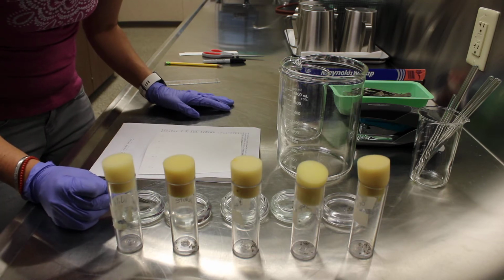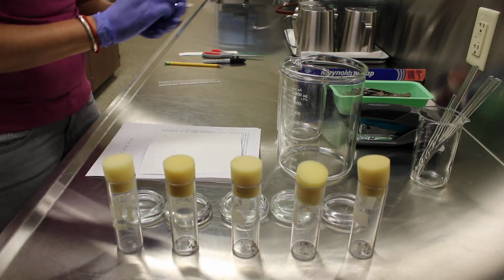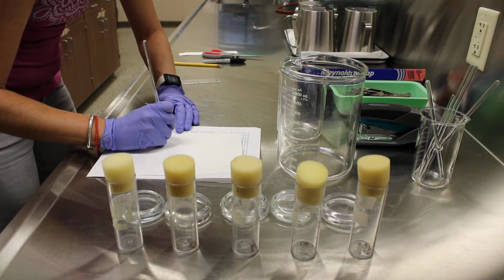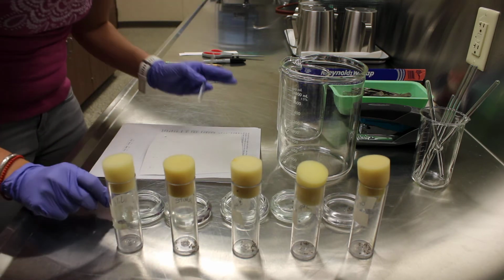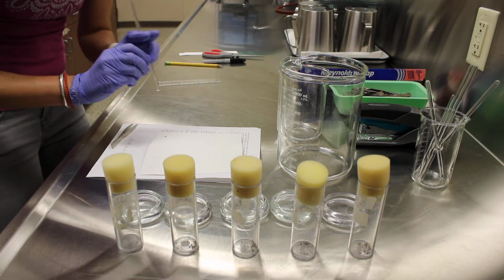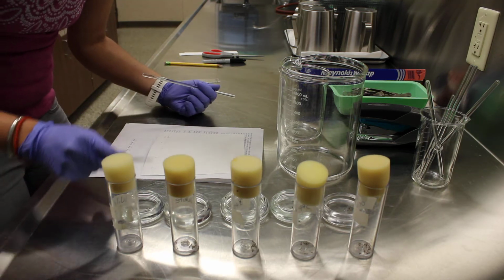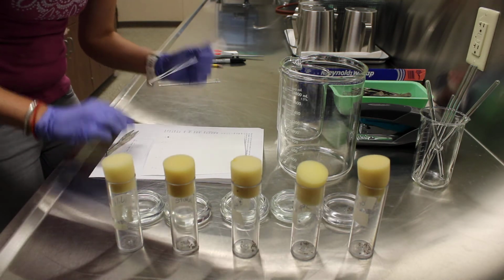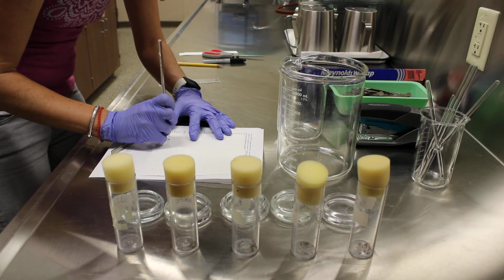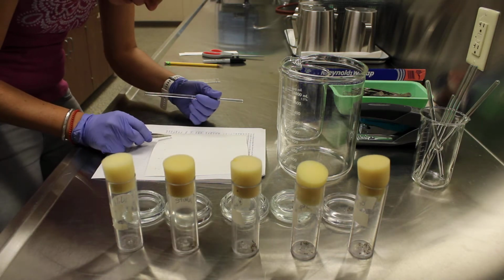So the kind of weird thing that we have to do in this lab is apply the fly pigments to the paper in order to do chromatography. So I am going to smash the heads of the flies on these little dots. So right now I'm smashing the wild type flies on that little tick mark that I showed you for wild type. And I'm going to do 4 of each of the fly phenotypes. And I'm trying to smash just their heads where their eyes are, but I'm really smashing a lot of their bodies. So this is my 4th one.